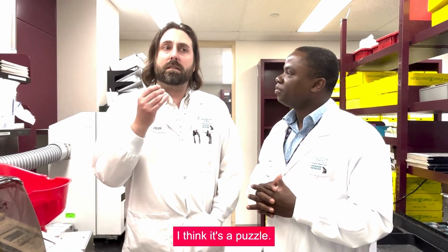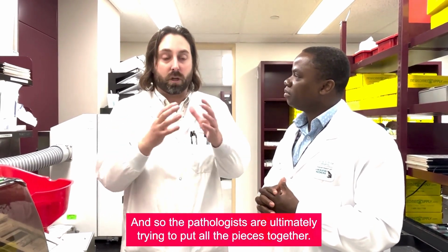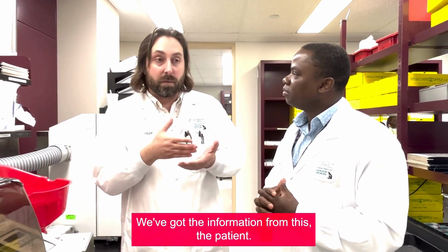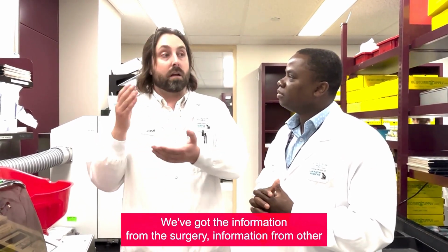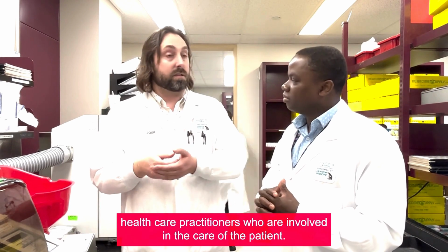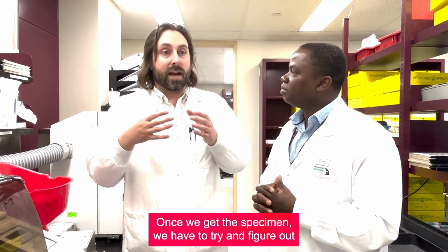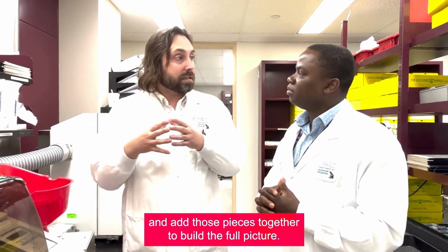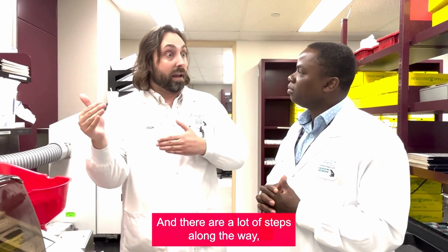I think it's a puzzle. The pathologists are ultimately trying to put all the pieces together. We've got the information from the patient, from the surgery, and from other healthcare practitioners who are involved in the care of the patient. Once we get the specimen, we have to add those pieces together to build the full picture. And there are a lot of steps along the way.